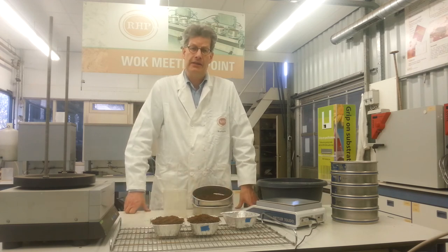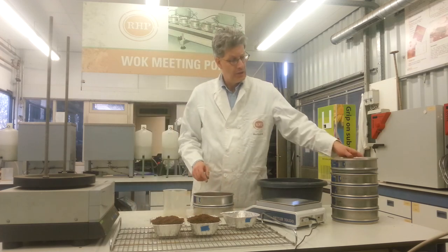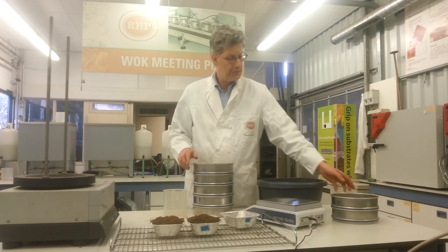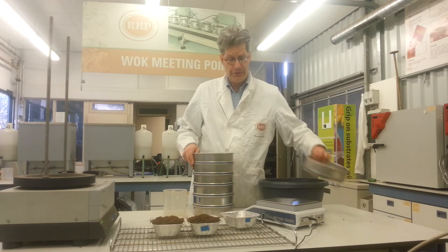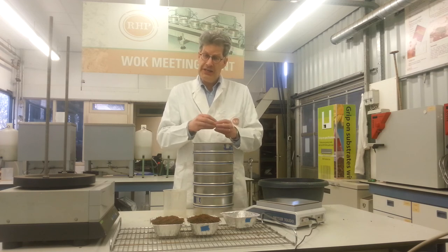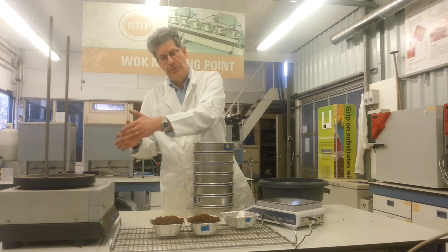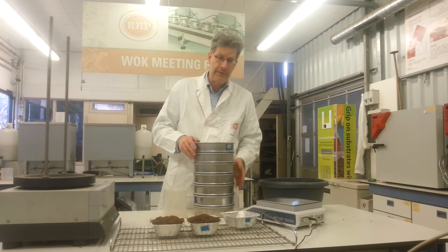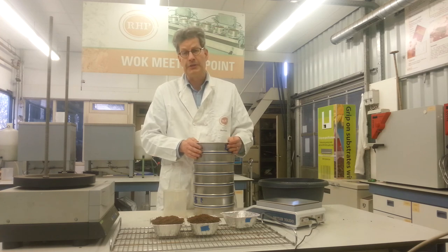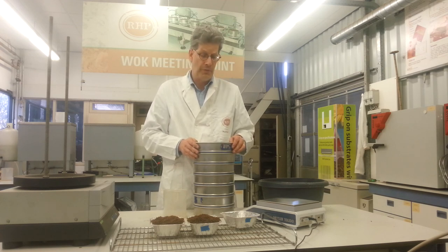In our screen procedure we have made an Excel calculation file in which you can enter the outcomes of the weight. There is one thing to keep in mind: whenever there is much fiber in peat materials, you will find them especially on the larger screens — mainly on the 31.5mm screen. When we find fibers, we take them out, release any particles stuck in them, put those particles back, and run the screen for one extra minute. Then we do the weighing. The fiber we can weigh separately, and when we record the scale weight, we put them back and take them along in that fraction. It is all written out in the method description, and you can also find how it works with the Excel file.